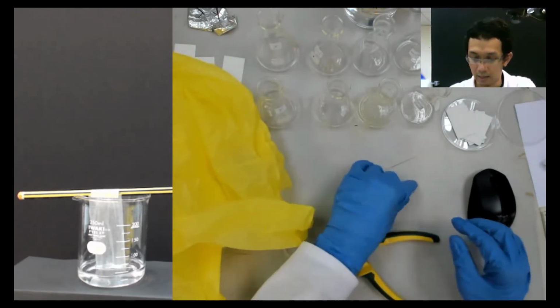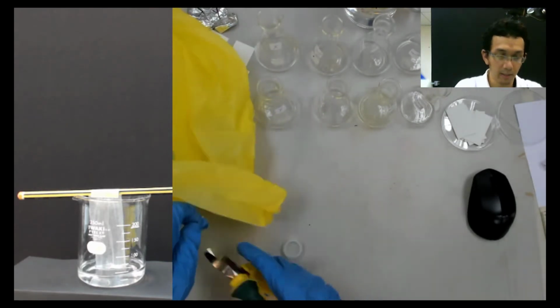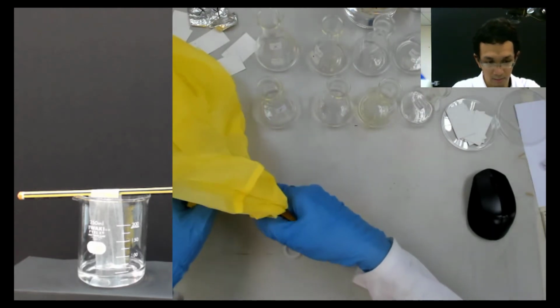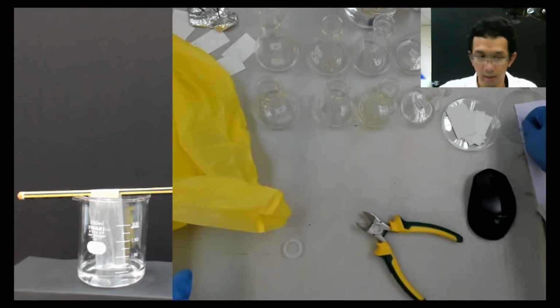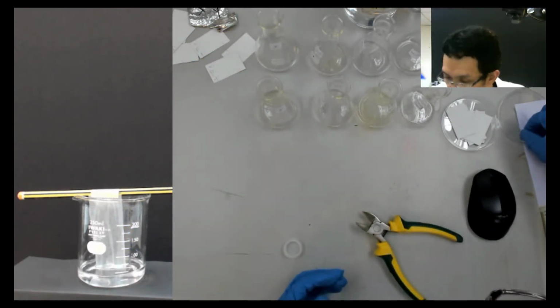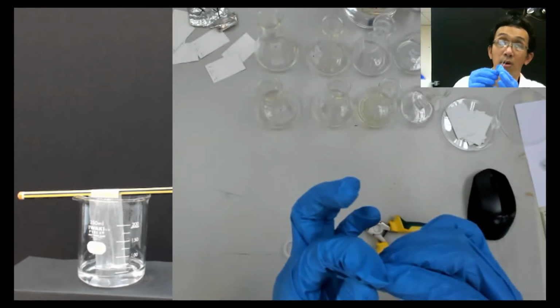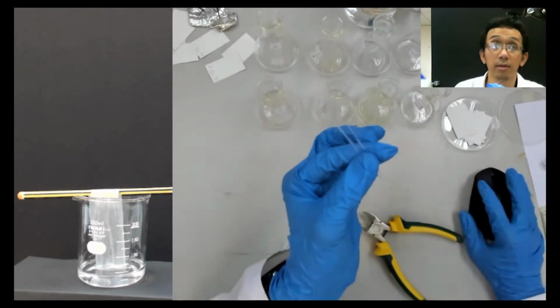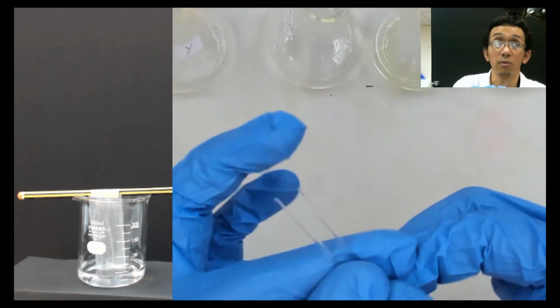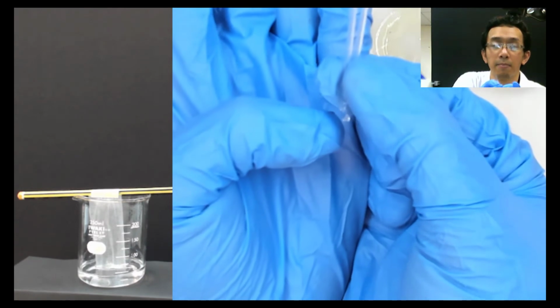Okay, and then the other one inside the plastic. Okay, so now done. We put the plastic away, and you see now, we have two. Let me zoom a little bit. Okay, we have two things now. Both are open because we already broke this part.